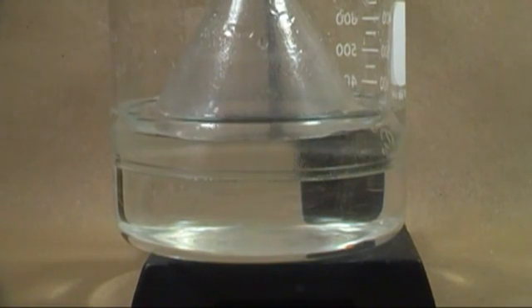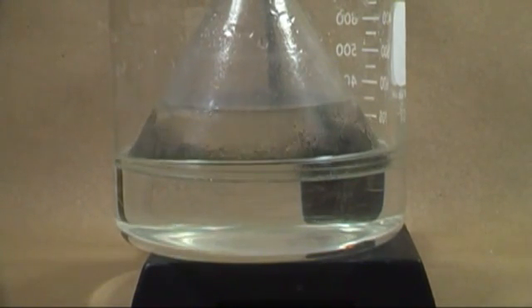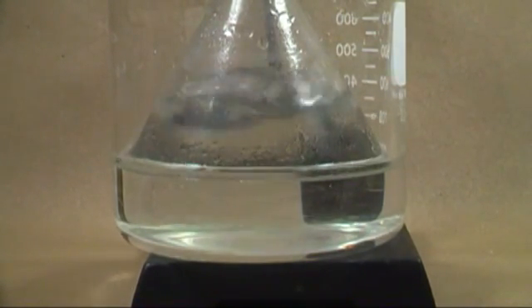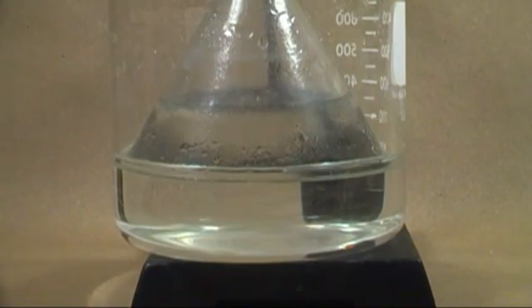the funnel takes up all the volume of water that it can and then starts sucking in outside air, equalizing the pressure. This continues as long as the pressure decreases.